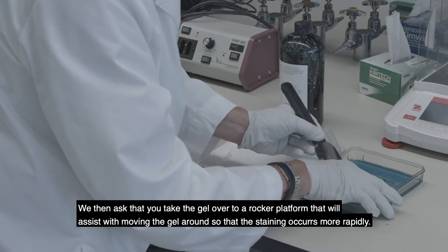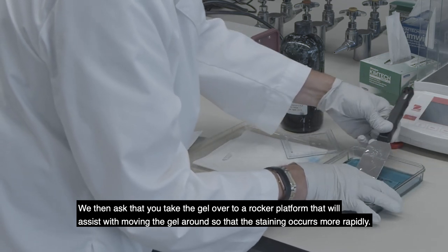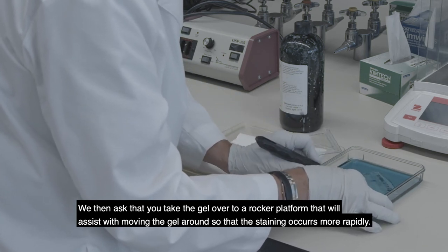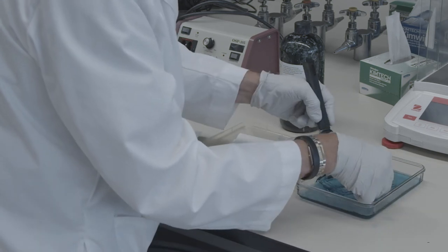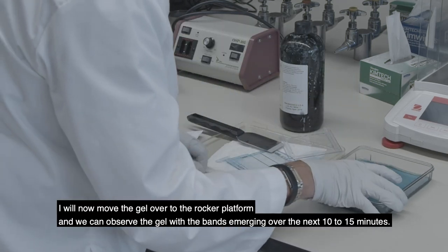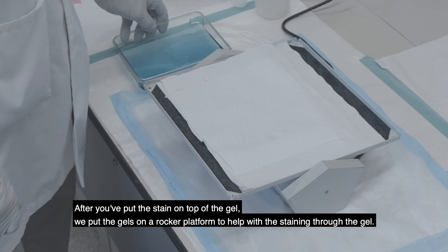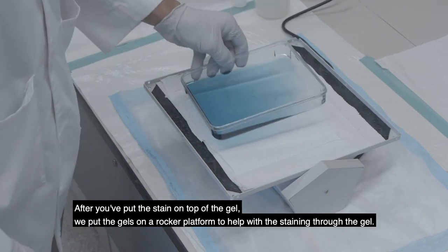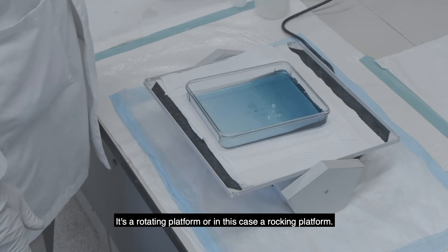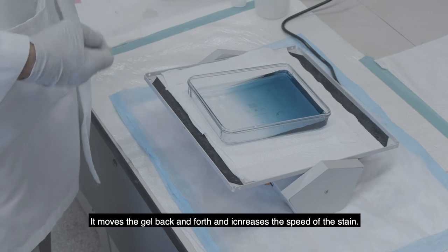You can use a pipette or a spatula to release the gel from the backing plate. It will take approximately 10 to 15 minutes for the stain to diffuse into the gel and identify all of the protein bands. Take the gel over to a rocker platform, which assists with moving the gel around so that staining occurs more rapidly. The rocker platform is a rotating or rocking platform that moves the gel back and forth and increases the speed of staining.